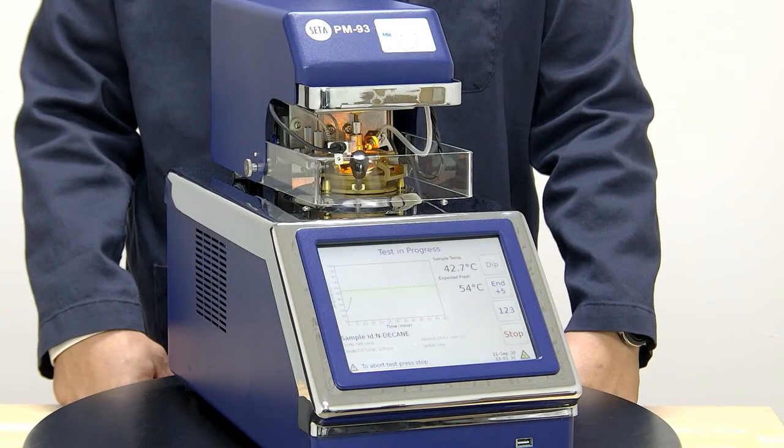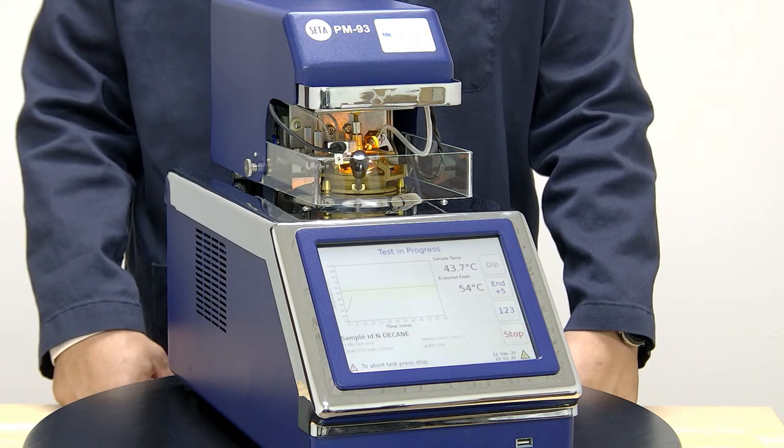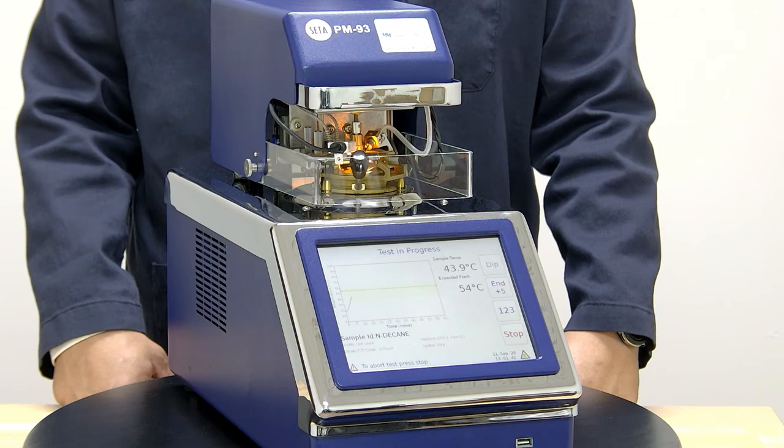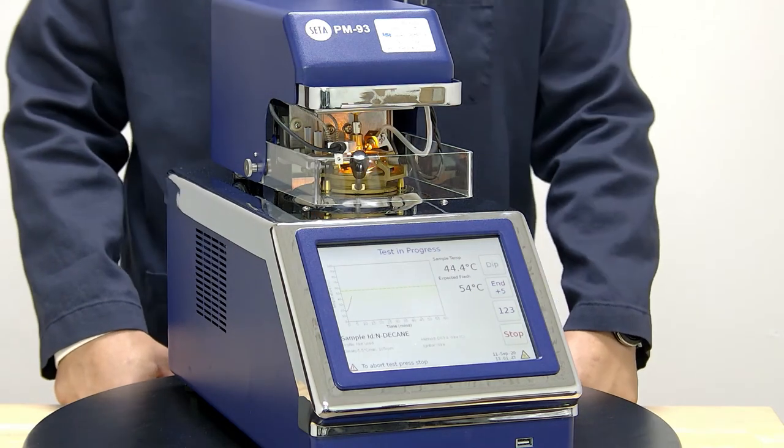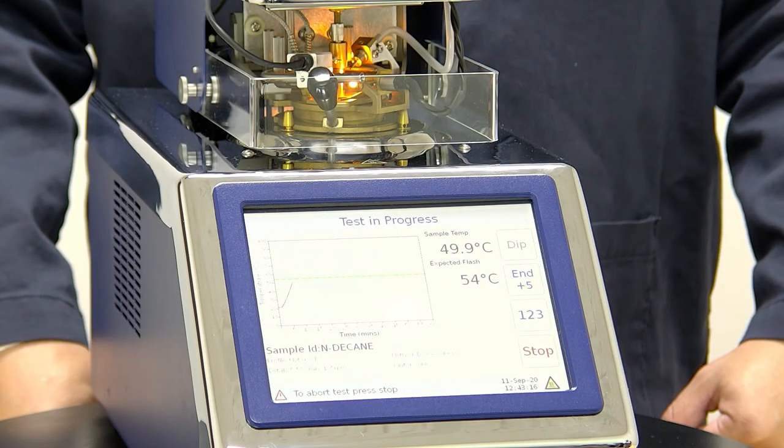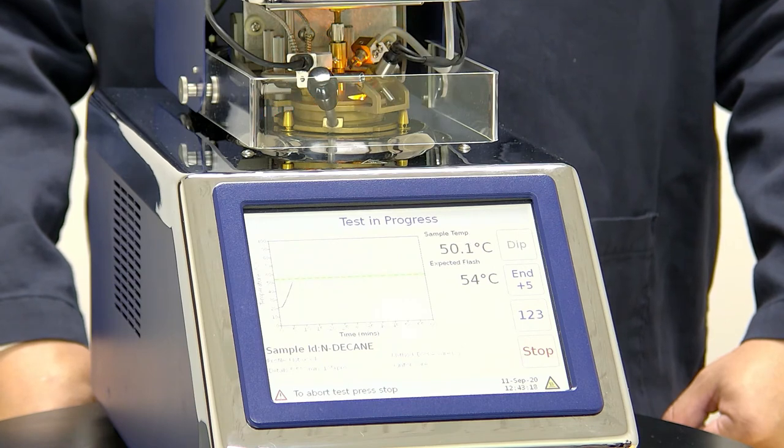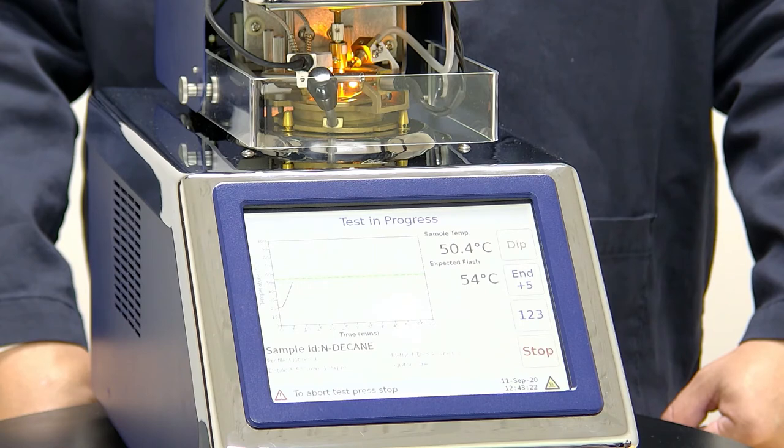The instrument will continue to dip here until we hit our flashpoint, at which point the instrument will stop heating and dipping and start cooling down. Now that we're approaching the most exciting part of the test and getting near flashpoint, we'll cut back in and take a look.